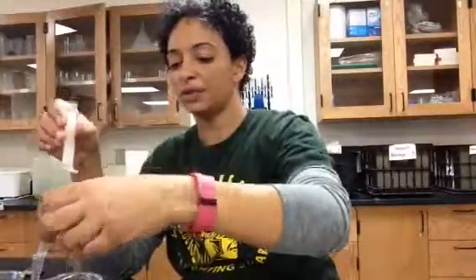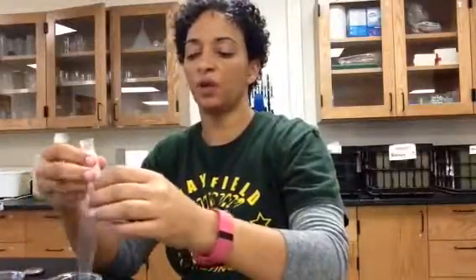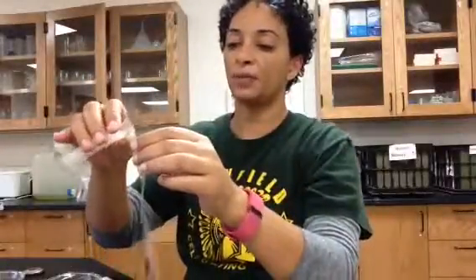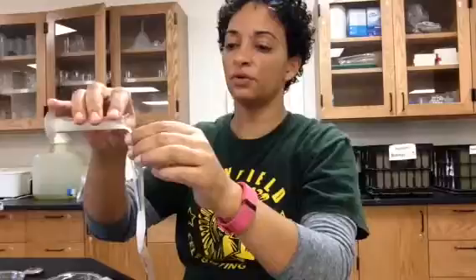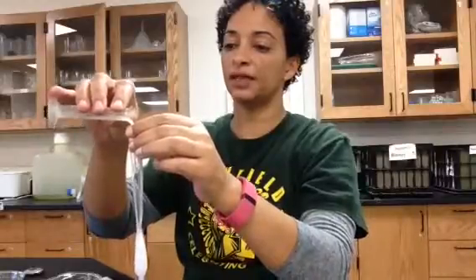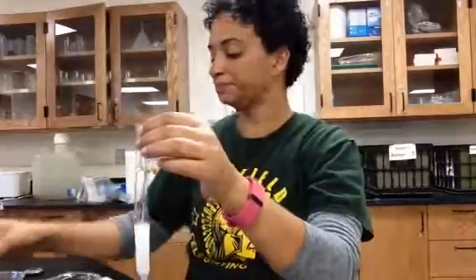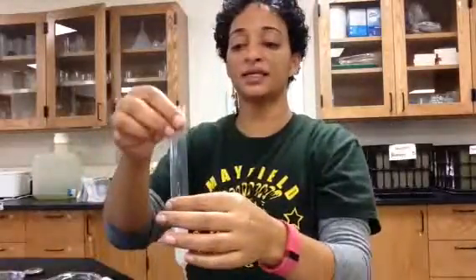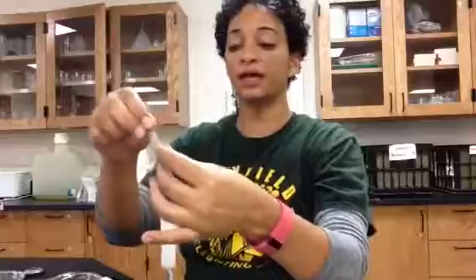I'm going to get my dialysis tubing — if it dries out, just put it back in the water and it'll get flexible again. I'm going to open it up and pour the 10 milliliters of glucose-starch mixture into the dialysis tubing, hopefully without spilling it everywhere.